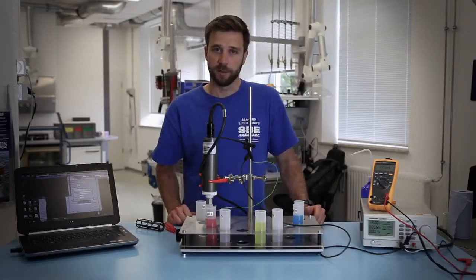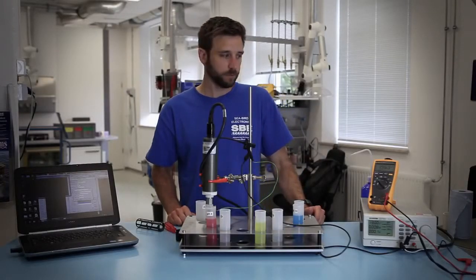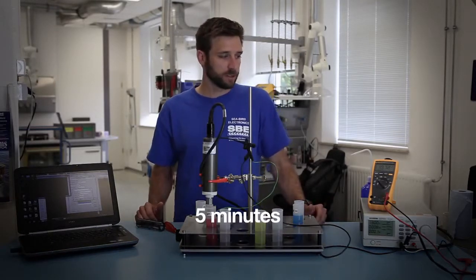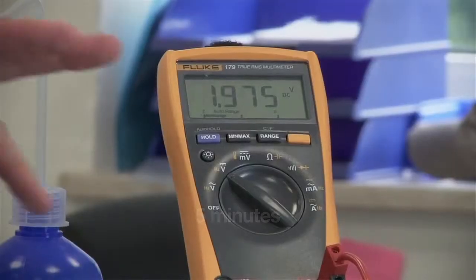So this will help stabilize the reading. You want to leave it in the solution for five to ten minutes until you get a stable voltage output on the multimeter.